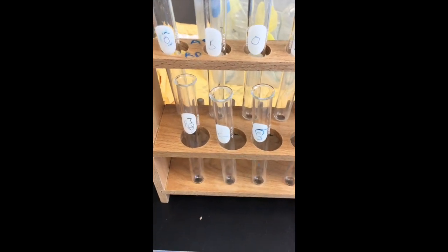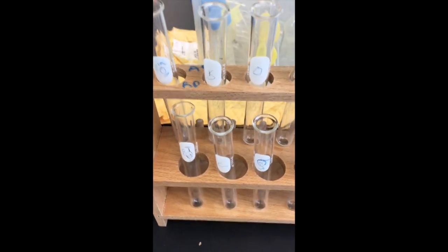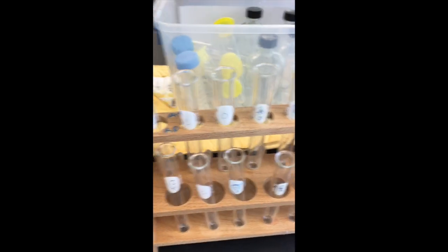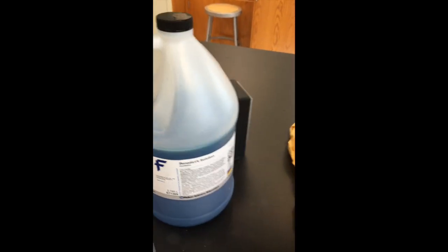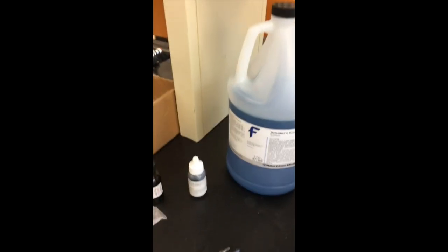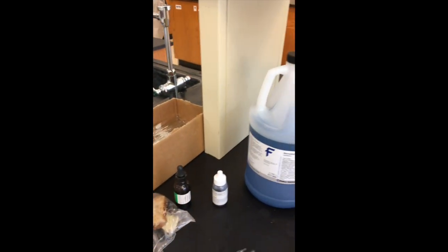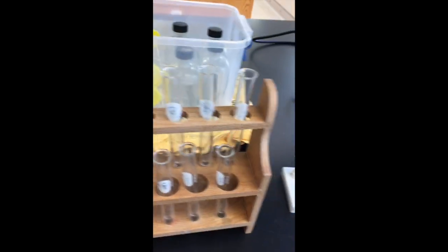Now what we are going to do is take these things and put them in test tubes with some water to help dissolve and to absorb things. And then once we get it mixed up together with the water, we're going to add some of these indicator chemicals. What these indicator chemicals do is they show us whether or not a simple carbohydrate or a complex carbohydrate or a protein is present in the sample. We're going to put a little bit of that indicator compound with the water and the food into the test tube. We're going to test, and we're going to see what has what in it.